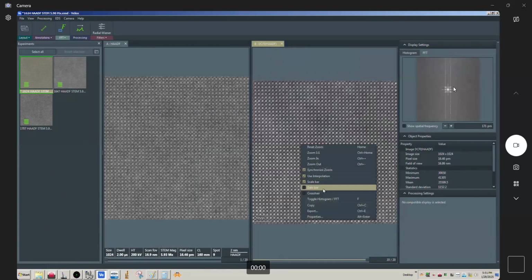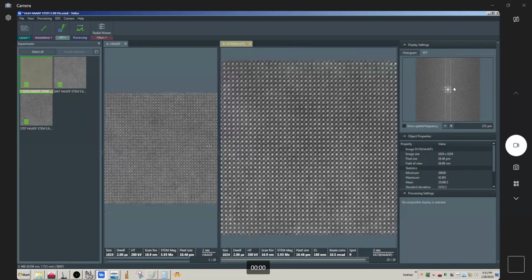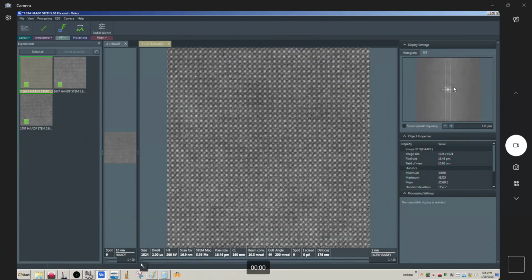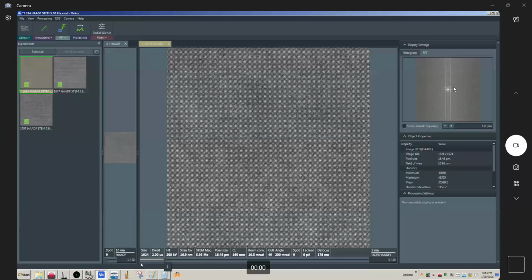And let me switch to data bar. Now you can see there's parts of this that look pretty good. But if you look up here, let me expand this, you can see toward the top, this is looking not so hot. It's looking kind of smeared, a little blurry. And if we actually cycle through, let me start at frame 1 here, and watch what happens if you use the arrows just right. You can see what's happening here.